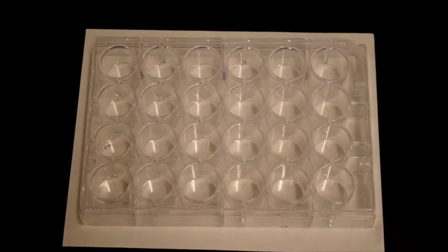Today we're going to be doing the soluble and insoluble salts lab, and we're going to start with part A, which is an investigation of the solubility of various cations and anions. We are going to do this by using this spot plate to mix various ionic solutions together and look for the formation of a precipitate. The formation of a precipitate indicates that an insoluble ion pair is present.